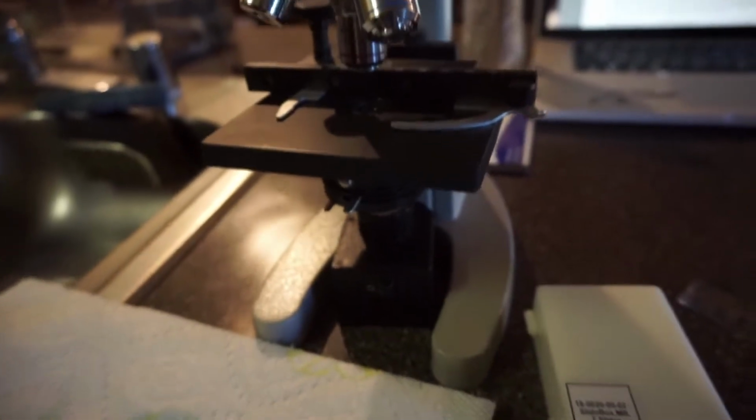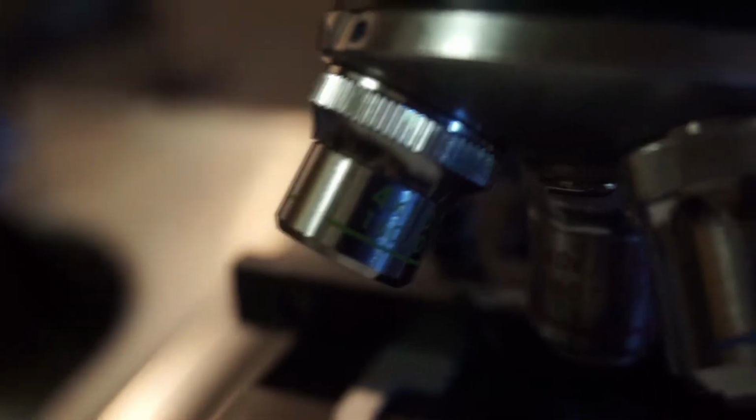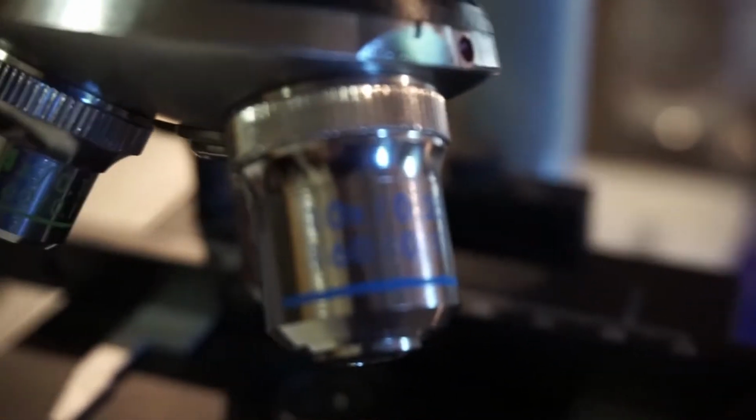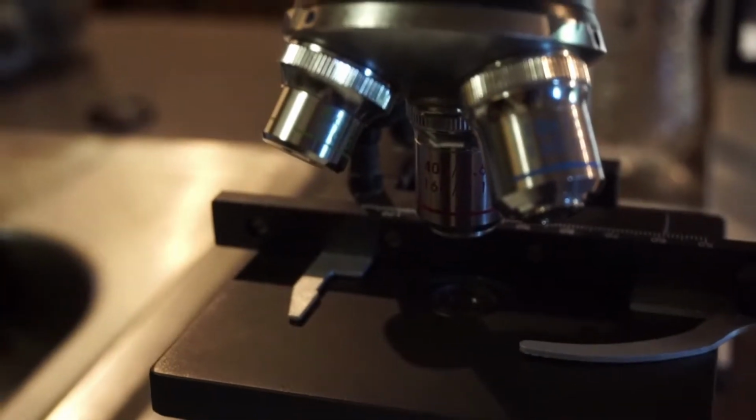Today is September 18th and right now I am doing the Microscopy for Microbiology Use and Function Lab. Here's my microscope. I got it set up last night. Right here, the 4X is the scanning power lens, and then the 10X is the low power lens, and in the back is the high power lens, and that one is 40X.